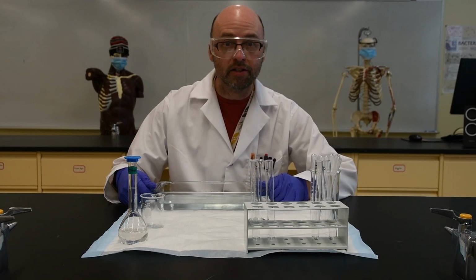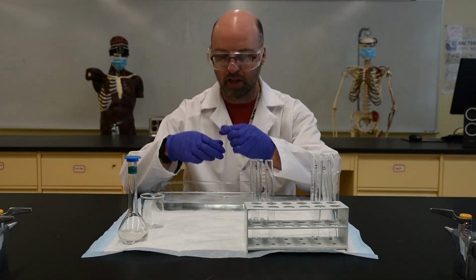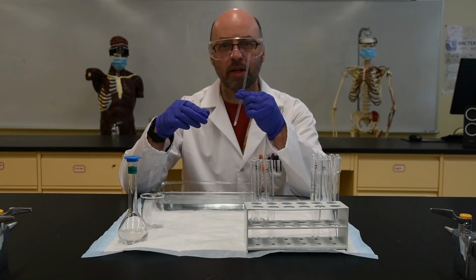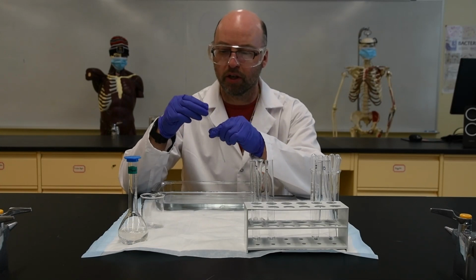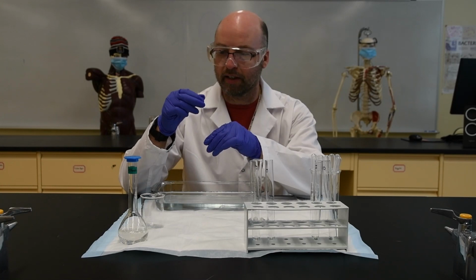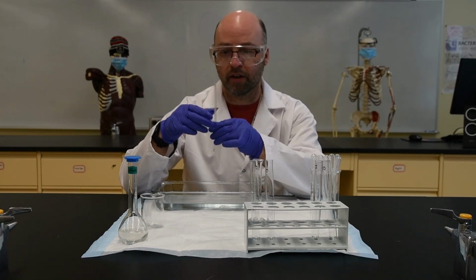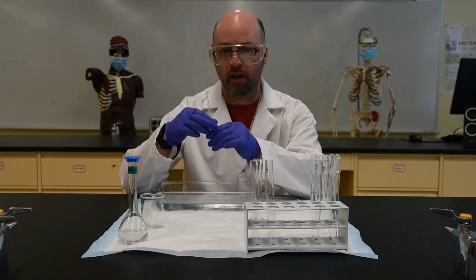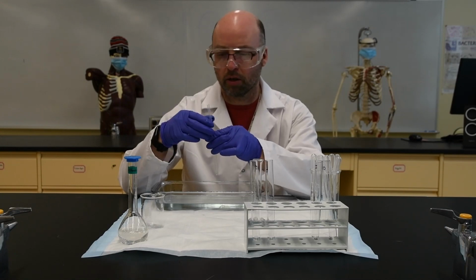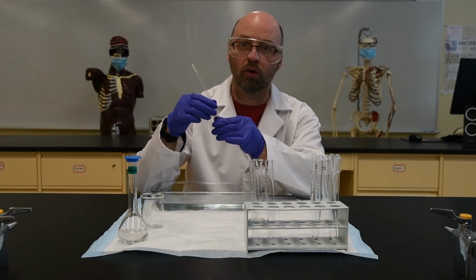Okay, so let's do our experiment. We've got our controls, and the second part, what we're going to do here is use some of this dialysis tubing. So this is like a semi-permeable membrane, and it's supposed to approximate a normal phospholipid bilayer. So basically it's dialysis tubing. It's used for people with kidney disease, to help remove the waste from their blood and add back items such as bicarbonate and so on and so forth. And basically it has lots and lots of tiny little holes in it.